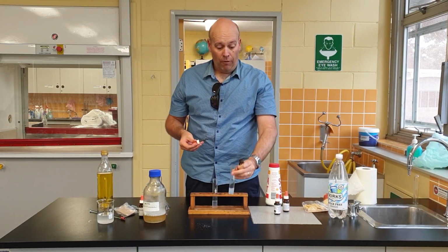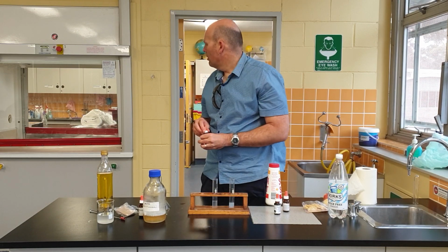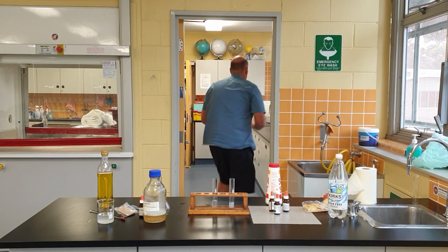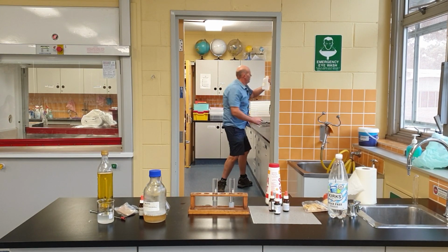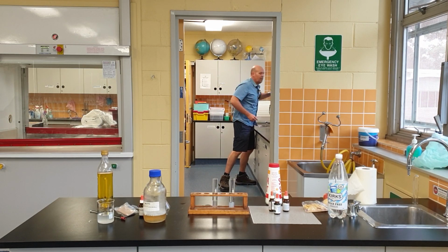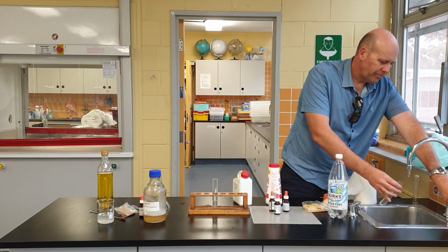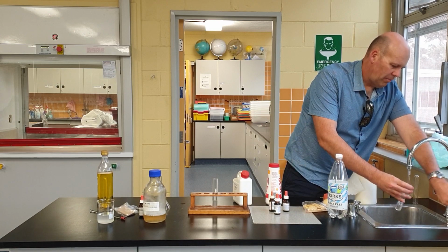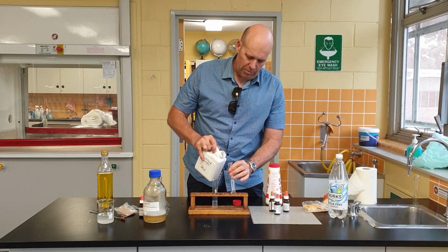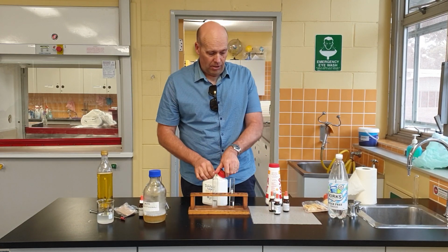If I was to do that with distilled water, I don't know whether I've got any here at the moment, but I might have some in the back. Hello, there's some distilled water. Okay, let's do it again with some distilled water, and see whether the silver nitrate changes the distilled water.